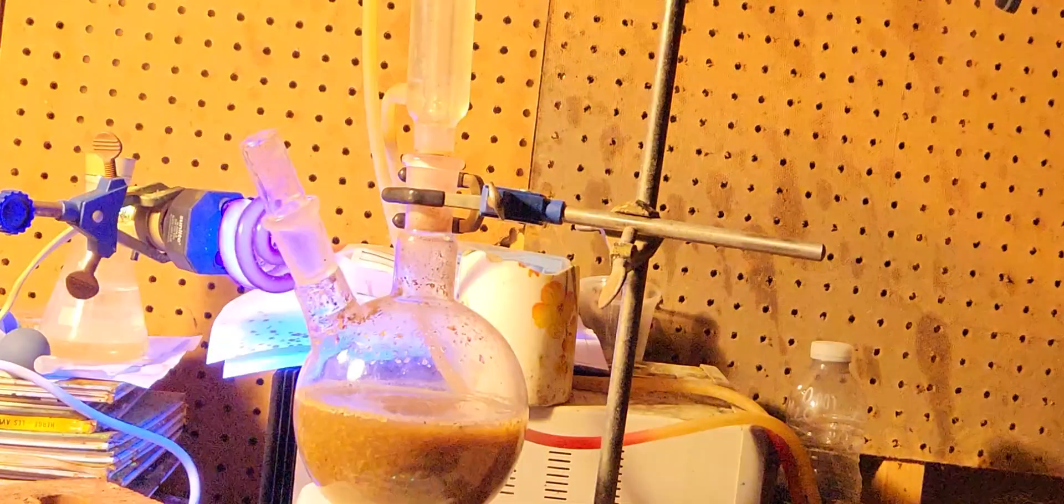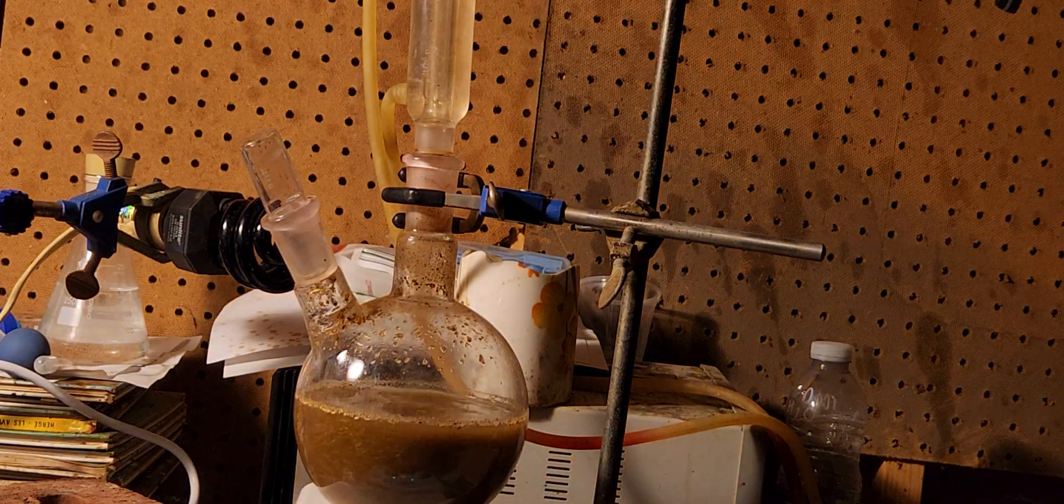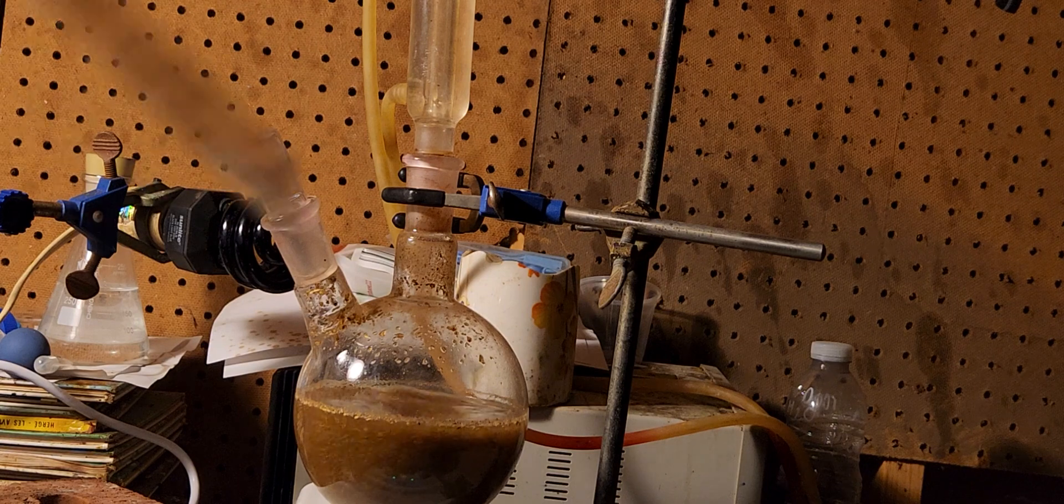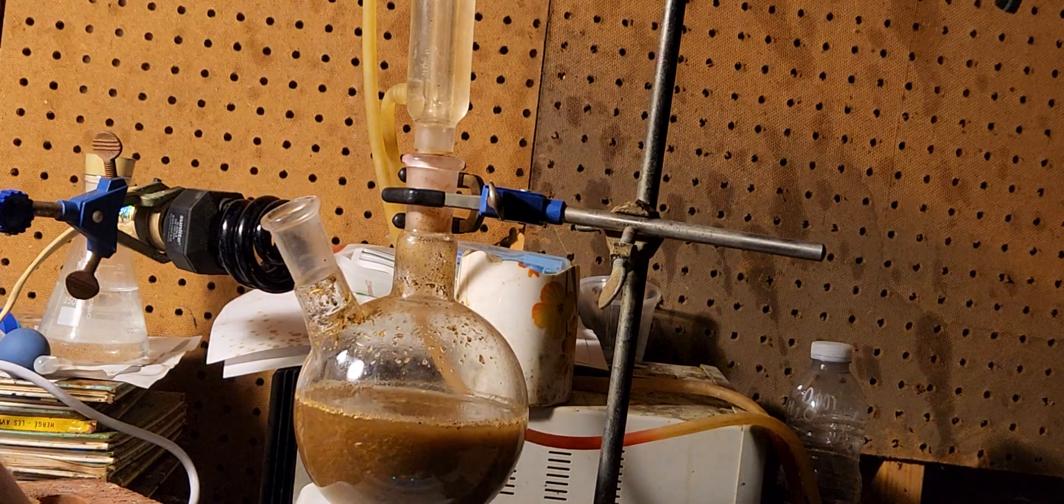And now I'm going to turn on this light, turn off that glow. That new UV lamp. And I'm going to add just a bit of acid, 10% acetic acid. 10 milliliters of acetic acid and approximately 2 milliliters of water.